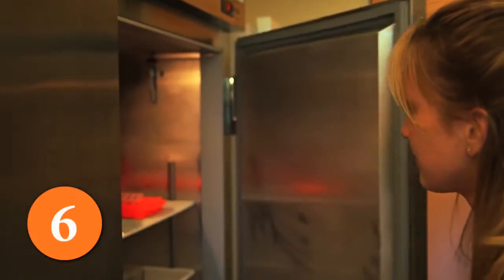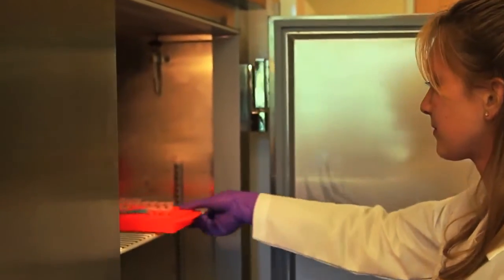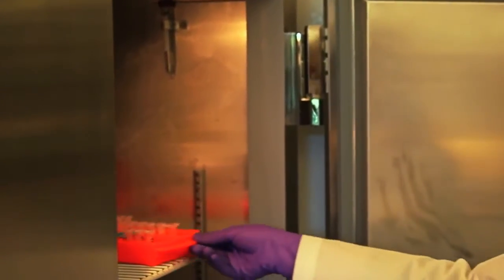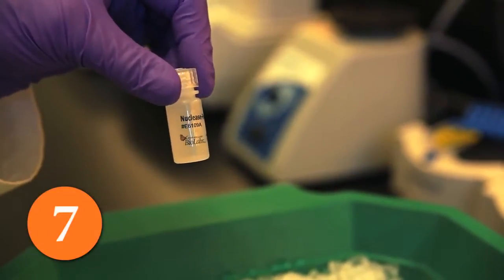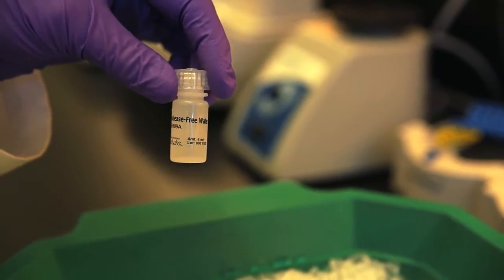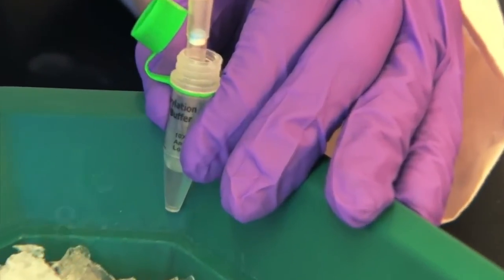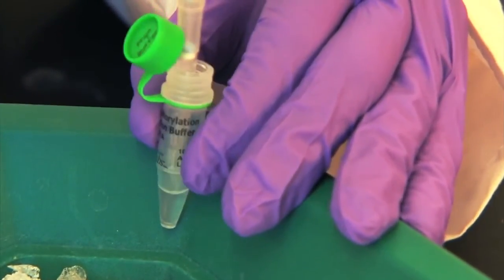Keep isolated RNA on ice and avoid freeze-thaw cycles. Purified RNA may be stored at minus 20 degrees or minus 70 degrees in water. Be sure to use nuclease-free water for dilutions. To efficiently mix reaction components, gently pipette up and down, and do not vortex.